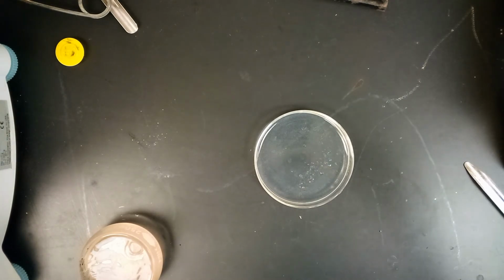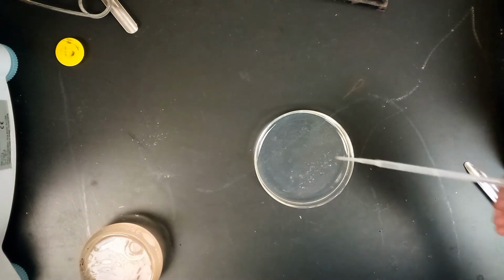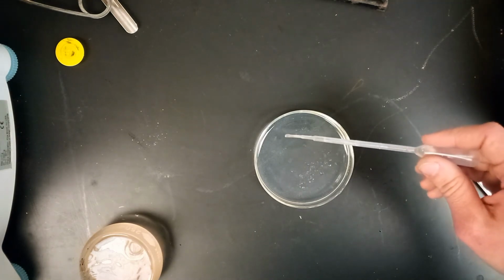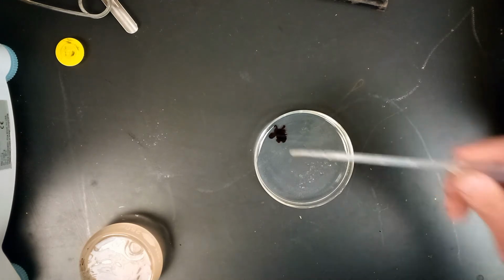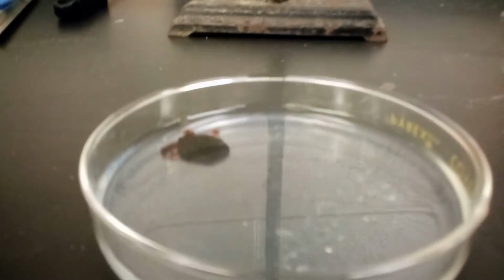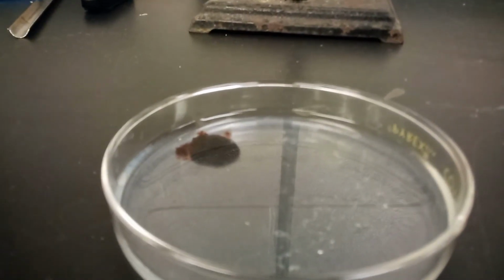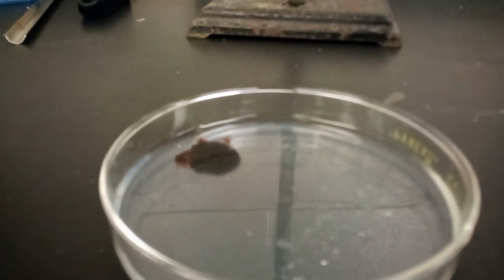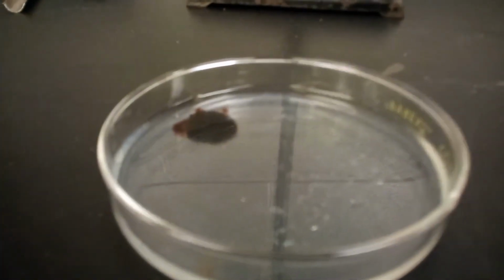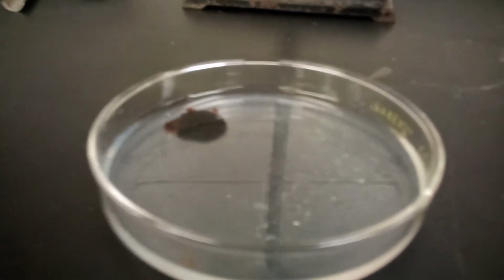Again, we're going to add another drop of this 0.2 molar iron(III) nitrate onto the petri dish. We saw earlier that when we added the iron(III) nitrate, it turned darker red, orangish. So we're not going to swirl this one yet because we'll add some potassium thiocyanate to this dish as well. So there you go. Again, record the color change after adding the one drop, this time around one particular location, like you can see here.